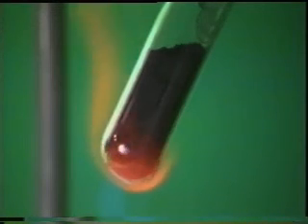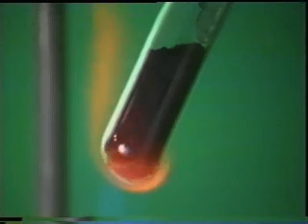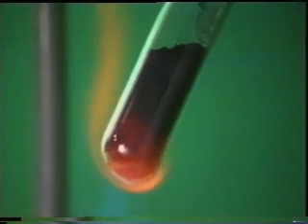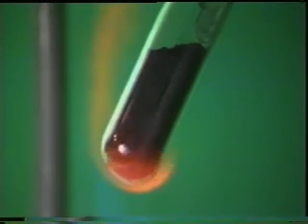As the black mixture is heated, the copper oxide is reduced to red copper by the carbon, which is itself being oxidized to carbon dioxide.